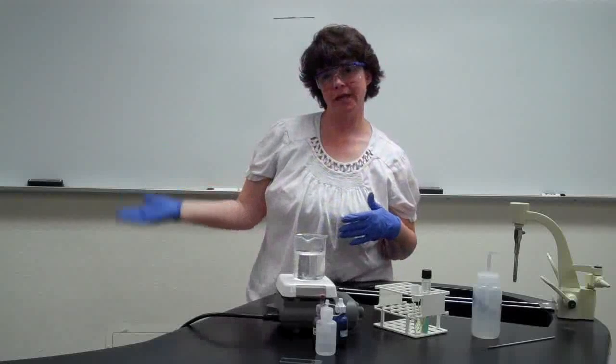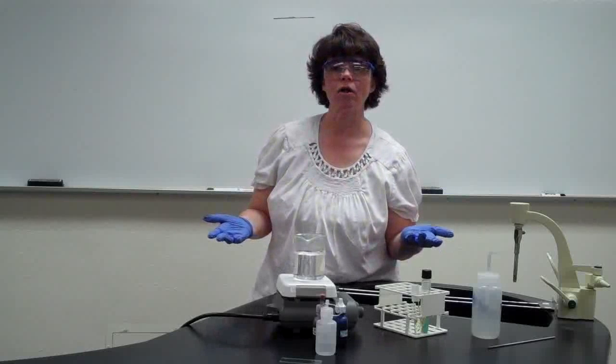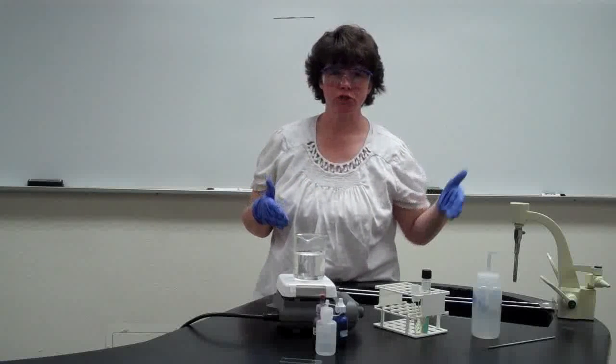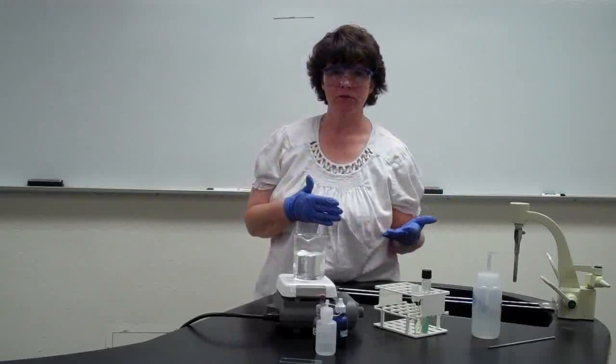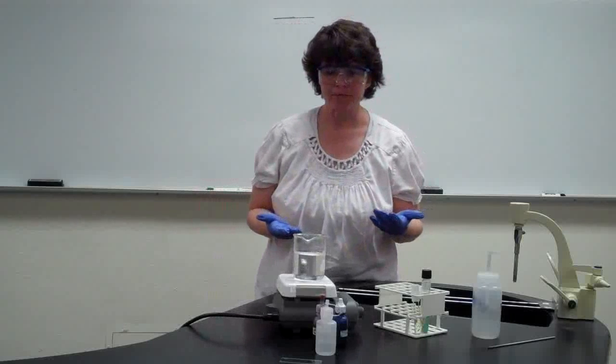And then when you go to do the endospore stain, green means endospore, red is just like the secondary color that you're going to get of the wall. So red doesn't always mean negative. It depends on which procedure you're using. So make sure that you are independent when you're thinking of what stain am I using, what do the results mean. So with that being said, let's talk a little bit about the lab that we're doing.